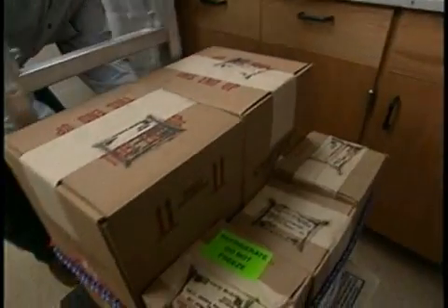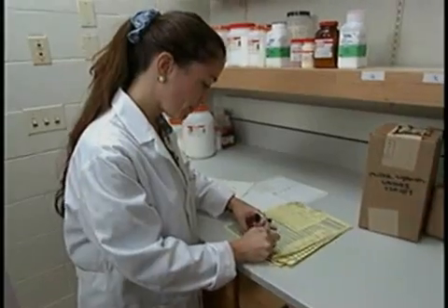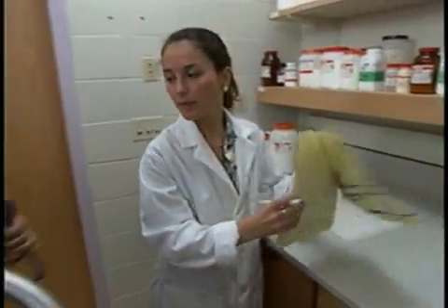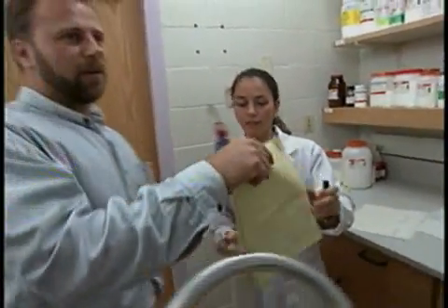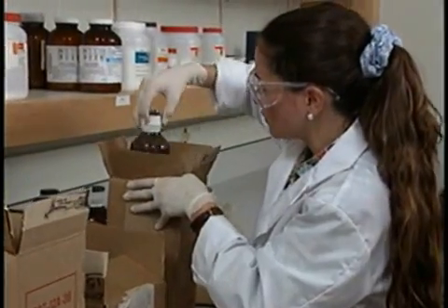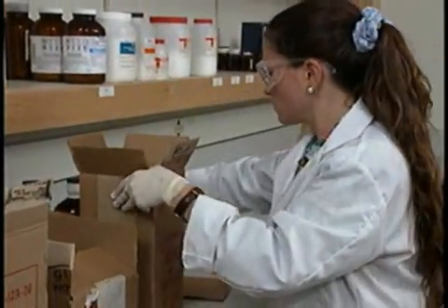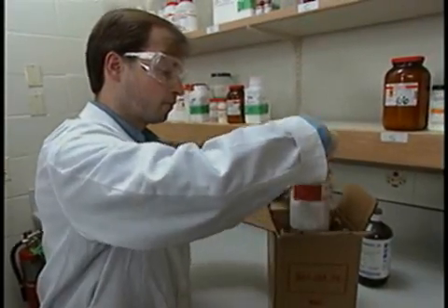With the arrival of the liquid and more hazardous chemicals, the storage guidelines now become a bit trickier. With some of these materials, there are formal limits on the quantities you may store. But even within the limits, common sense says keep in your laboratory no more than you'll need over a reasonable span of time.